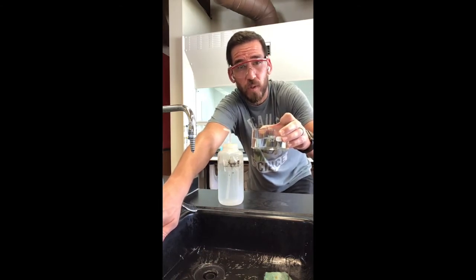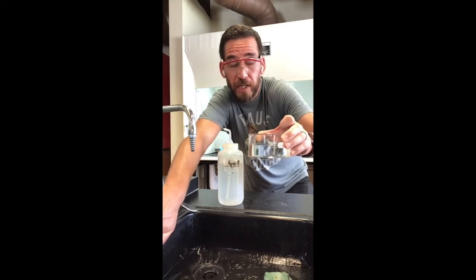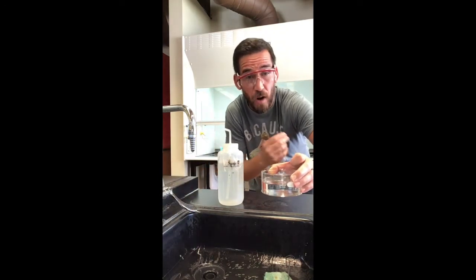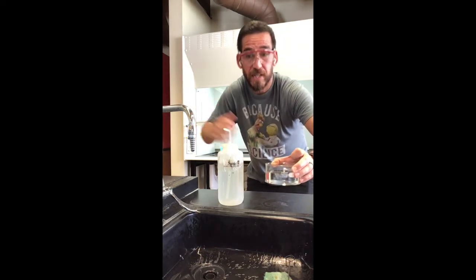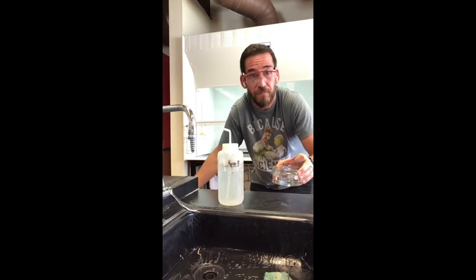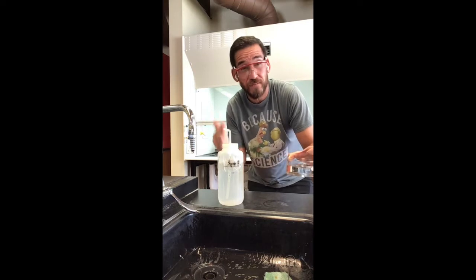Now what we're going to do is put it on a hot plate, turn the heat on, and walk away from it, checking on it periodically throughout the experiment. Then when it comes time to need that hot water to boil off our methylene chloride, we've already got it, and it's been heating up while we were working. Rather than getting your methylene chloride layer and saying, oh crap, I need a hot water bath, and then sitting around for like 10 minutes while it heats up to temperature. That's a waste of 10 minutes, right?